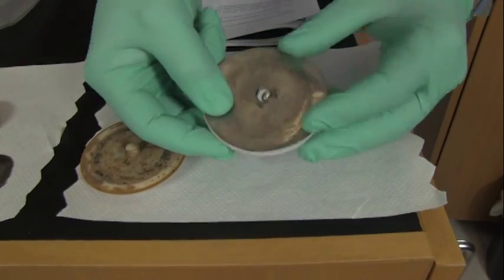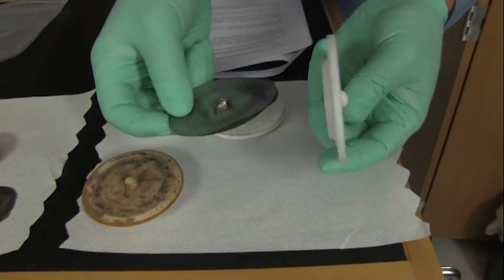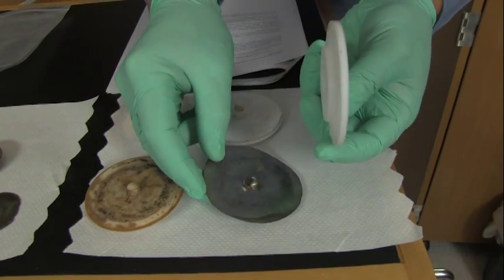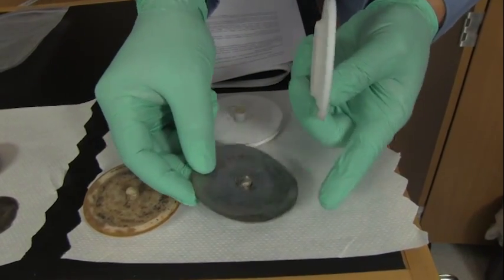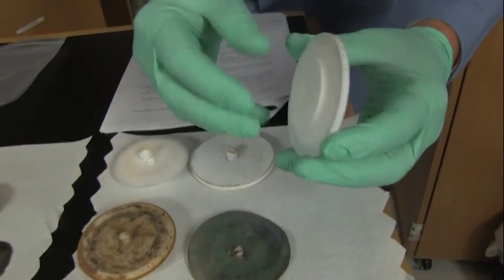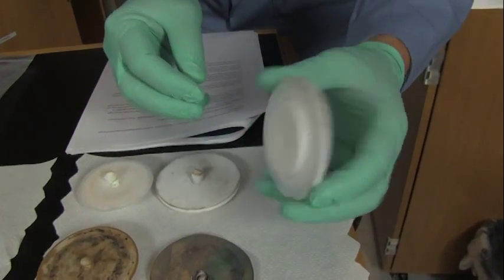Pressure deforms the PTFE lid. When the extruded PTFE dimple broke through the metal disks, the maximum allowable operating pressure was exceeded. It is time to replace the PTFE cup, lid, and rupture disks.